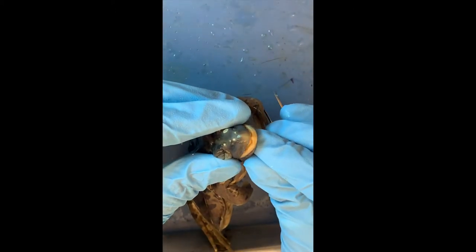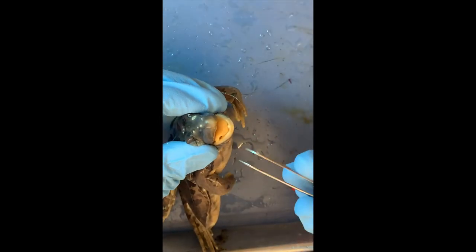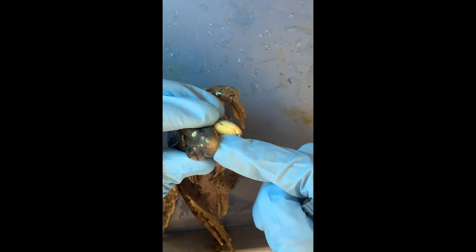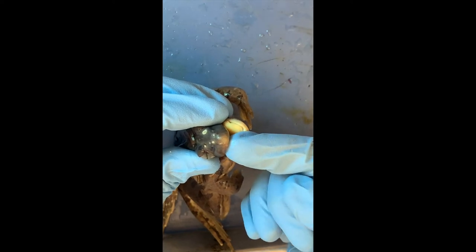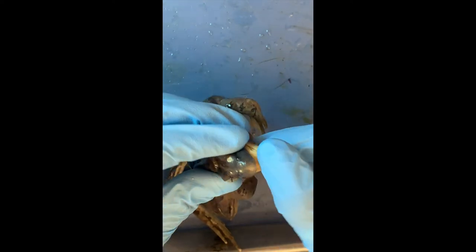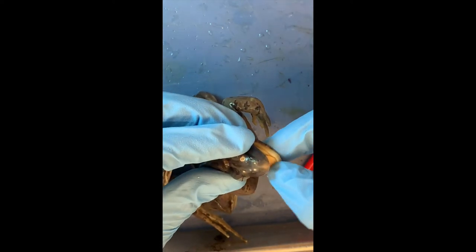I'm afraid of those teeth. Teeth? Yeah, frogs have teeth. I just felt them and I don't want to be hurt — they have a sharp mouth. They usually won't bite you, but if you stick your finger inside, you never know. Do you feel the teeth on both the bottom and the top jaw? On top, yes, they're definitely there. On the bottom — no, I don't feel anything.